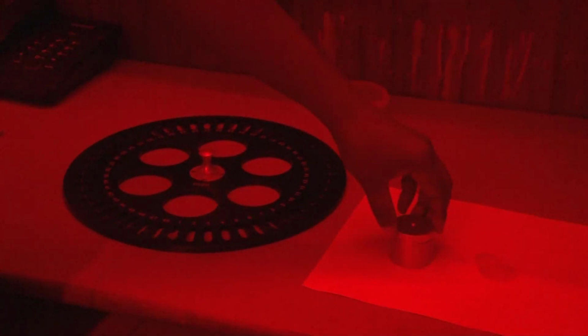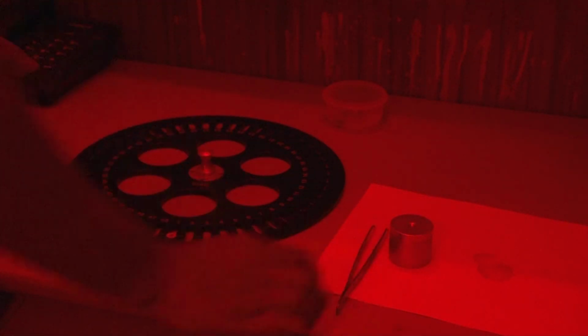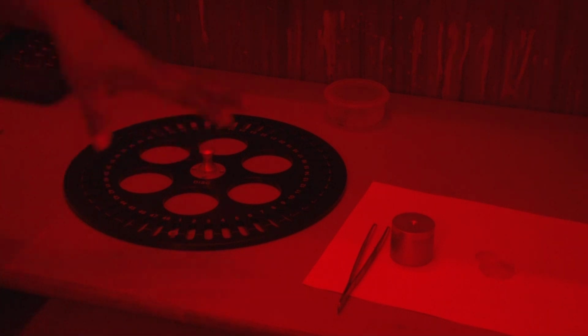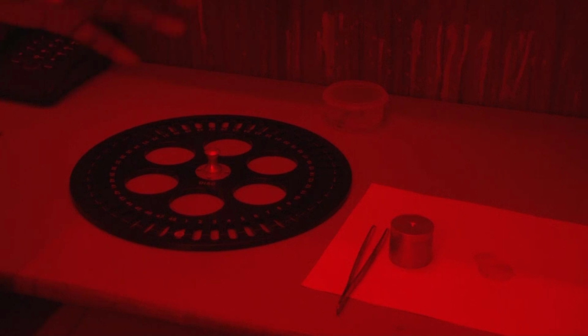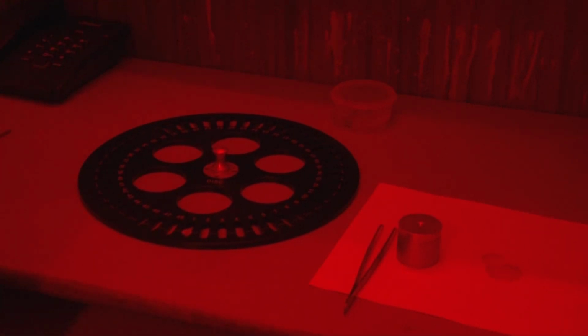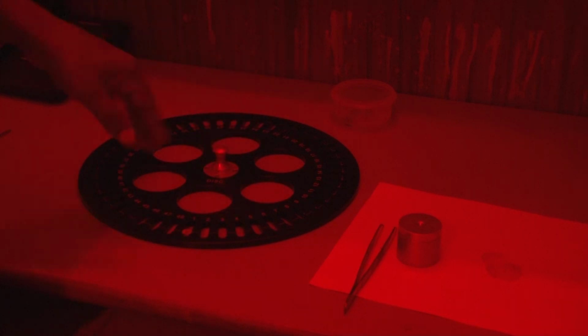But when you are measuring the age for your sample, you should try to prepare at least more than 10 aliquots. That would be sufficient for the age estimation or equivalent dose estimation, because the equivalent dose is basically the average of all the aliquots.